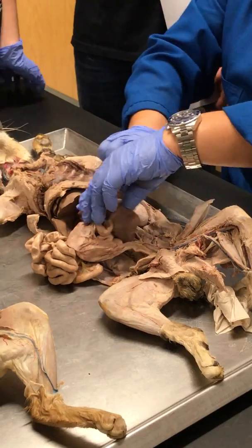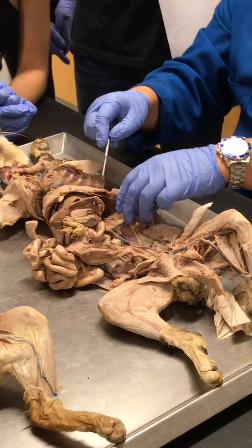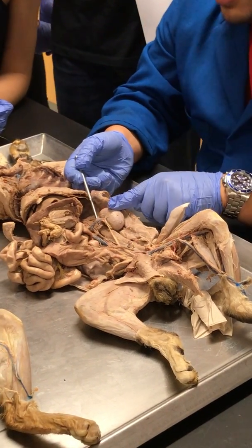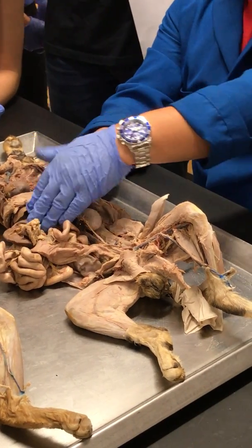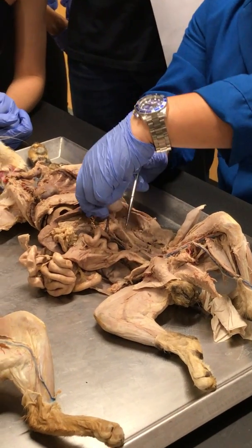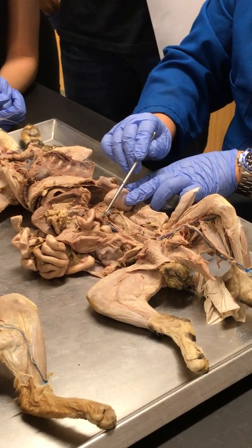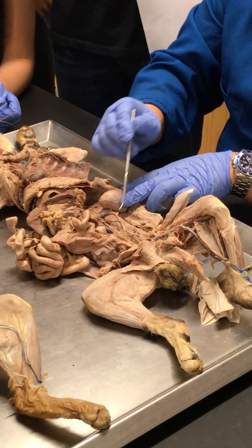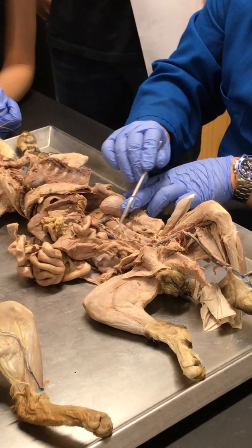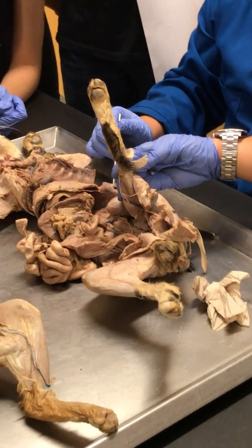Now, we did do some stuff here. So this is the kidney. You guys know that this part of the cat kidney, these two vessels are the renal arteries and renal vein. So this is the ureter. Great. And here we can see a really nice gonadal vein. There you go. This one here is the gonadal artery, or the testicular artery. Yeah, it's a boy.